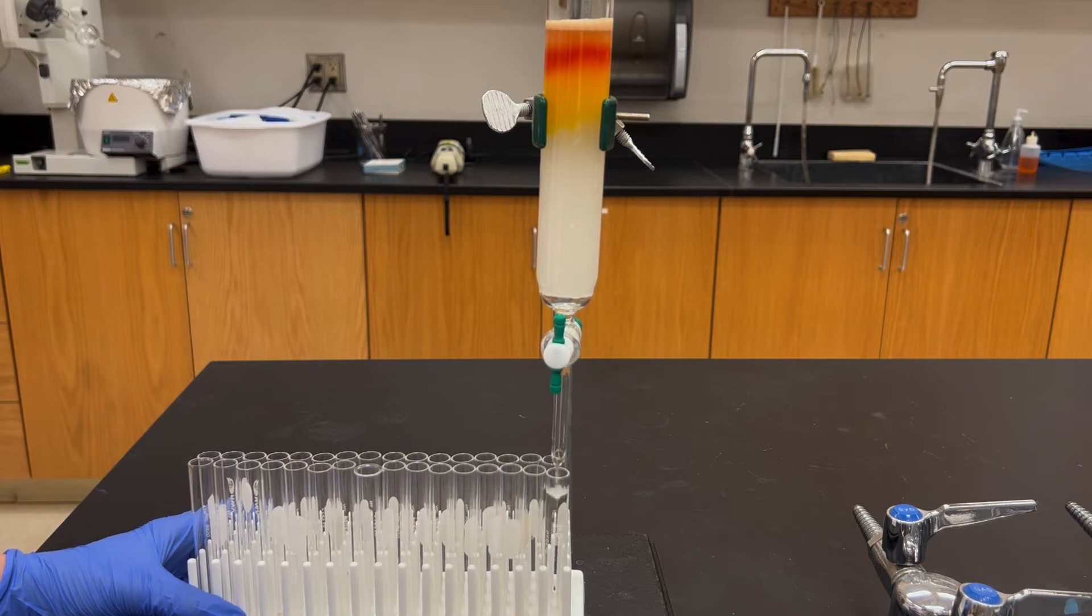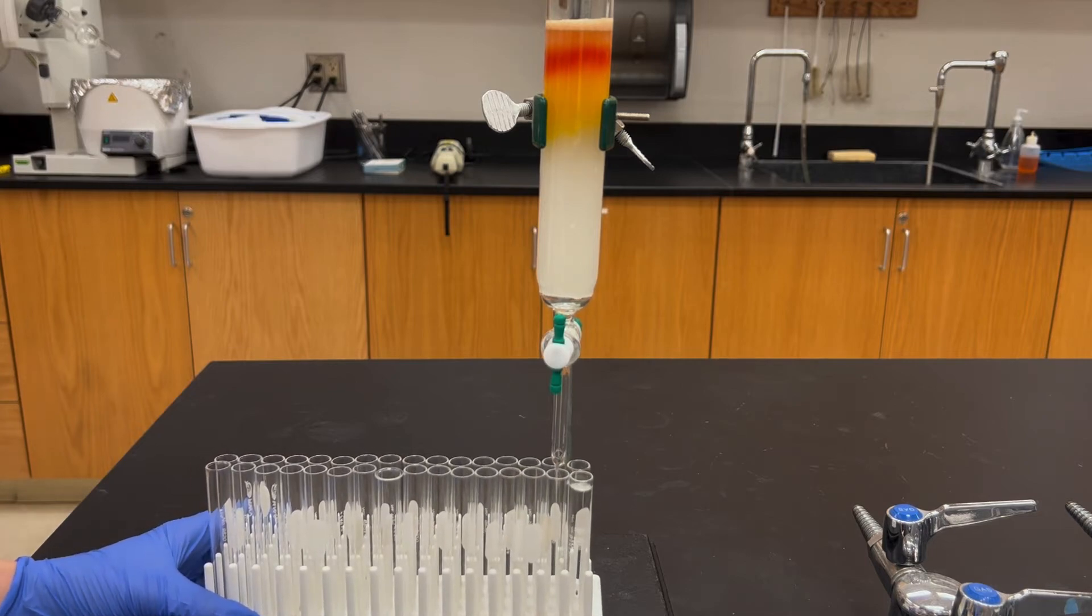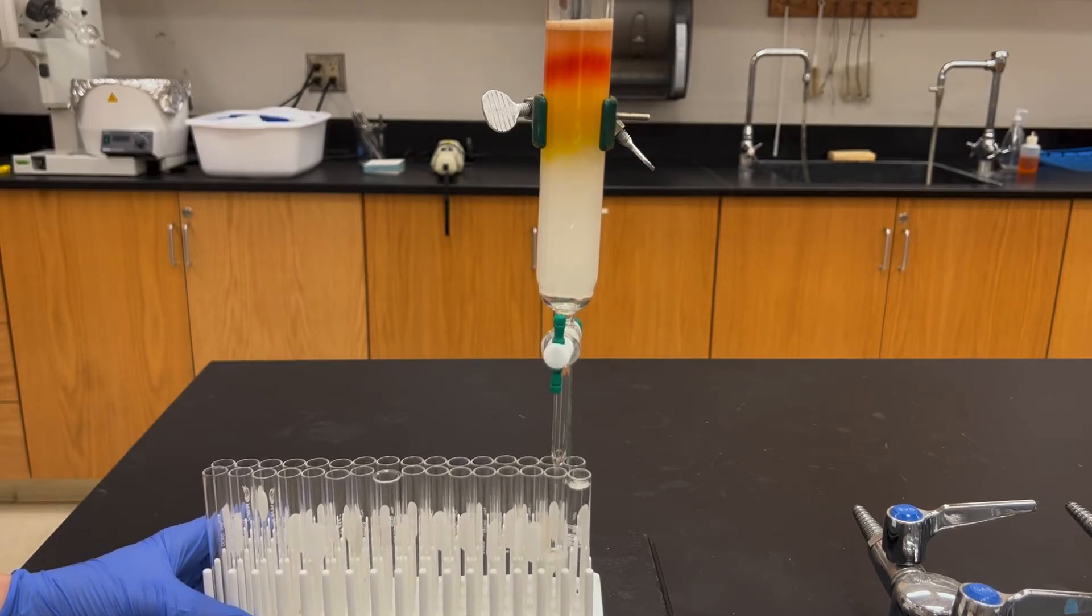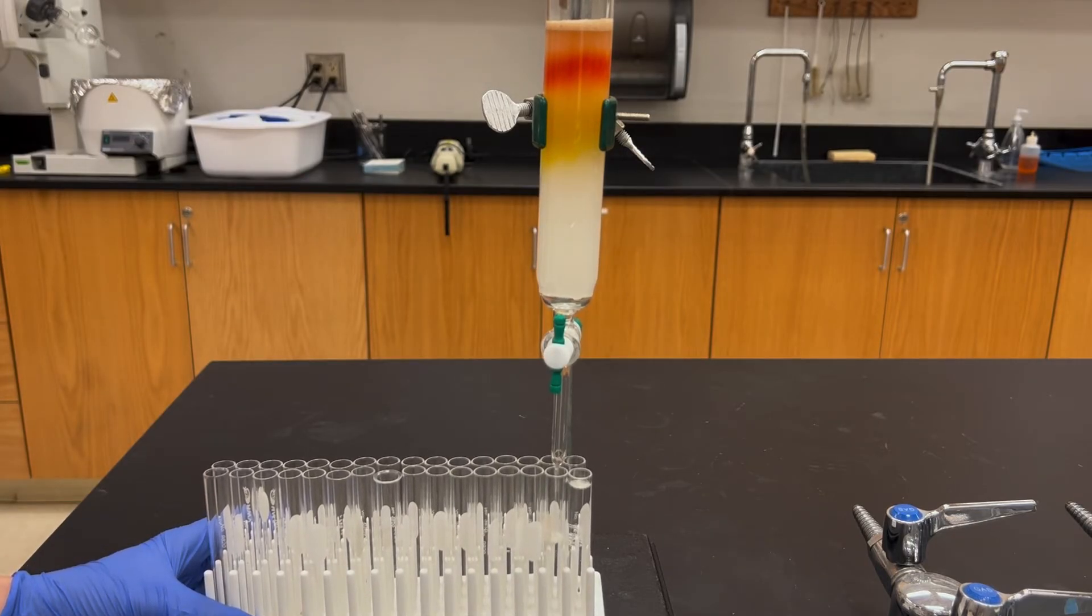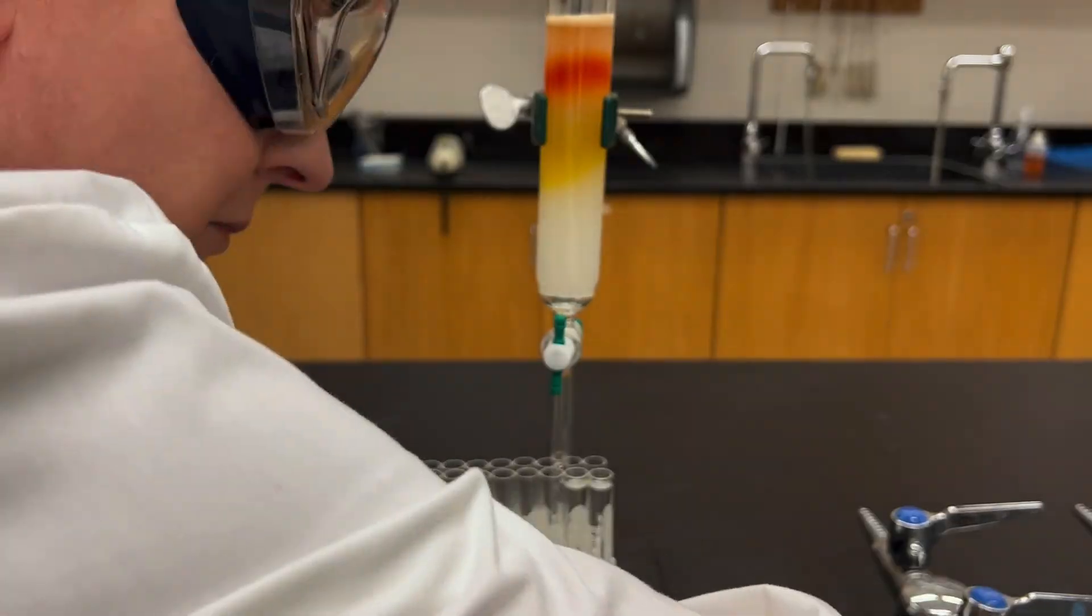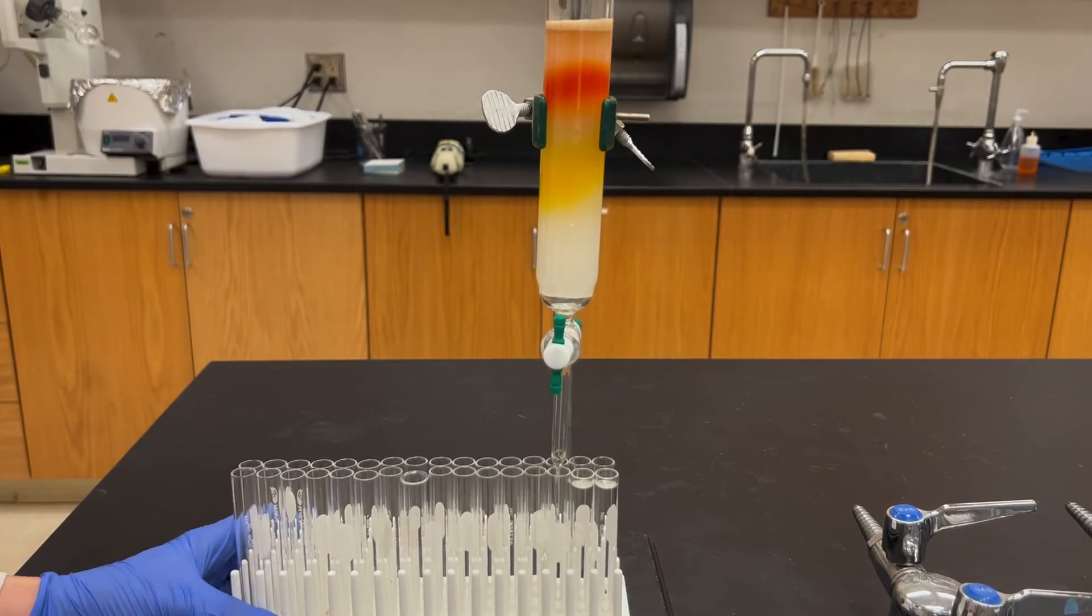Now instead of just letting the liquid drain out at its own rate, I'm going to apply air pressure to the top of the column to push the liquid through the column faster. This speeds up the entire process but it also makes for a better separation. I'm going to speed up the whole video and get through this a lot faster.